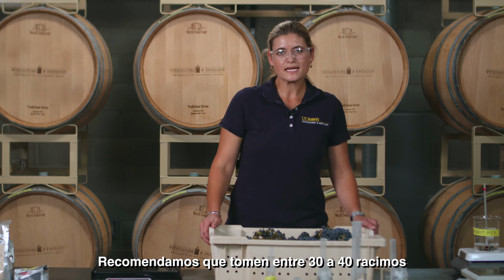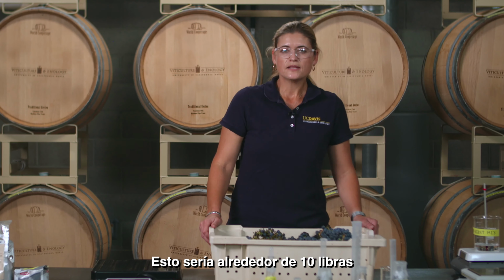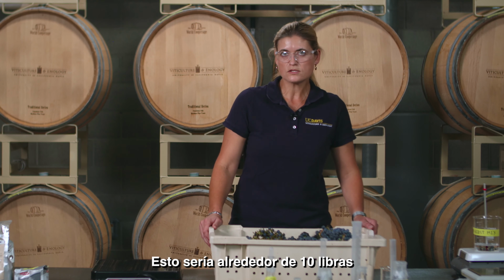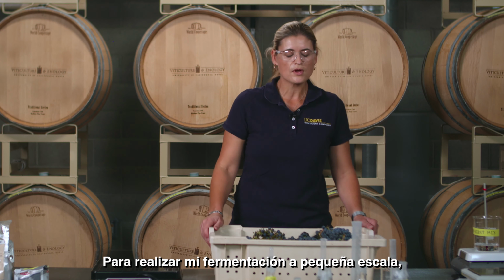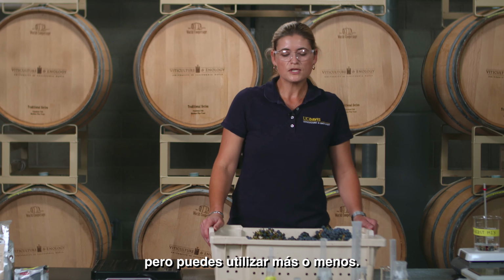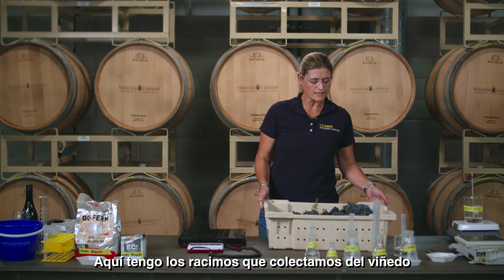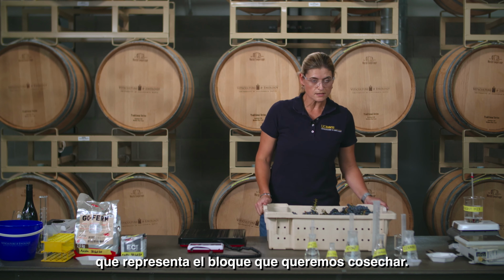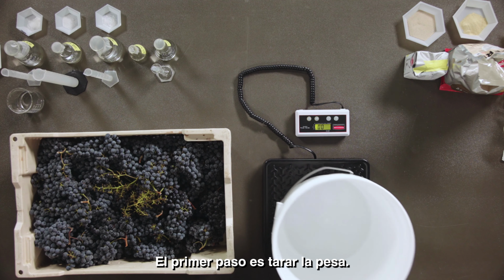We recommend that you take about 30 to 40 clusters per vineyard block that you want to assess, 1 cluster per vine. That would potentially be around 10 pounds, which is what I'm using today to do my small-scale fermentation with. That's a minimum that we recommend, but you can use more or less, whatever you see as representative of your block that you would like to assess. Here I have the clusters that we collected from the vineyard to be representative of the block that we want to harvest. First step, I'm going to tare my scale.